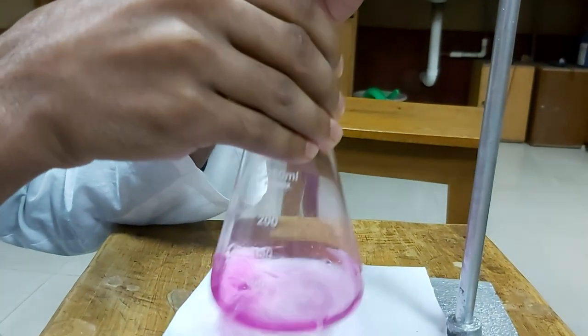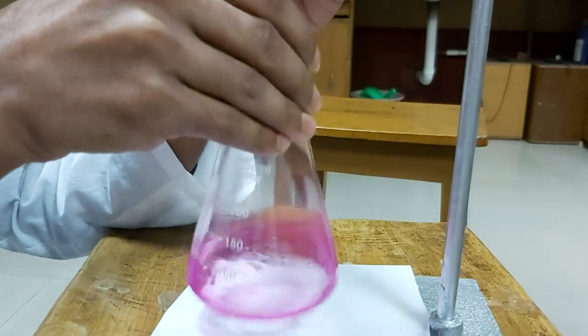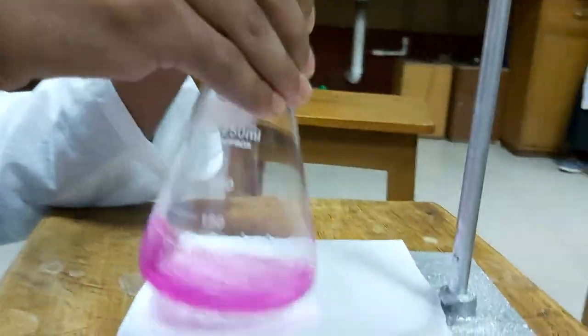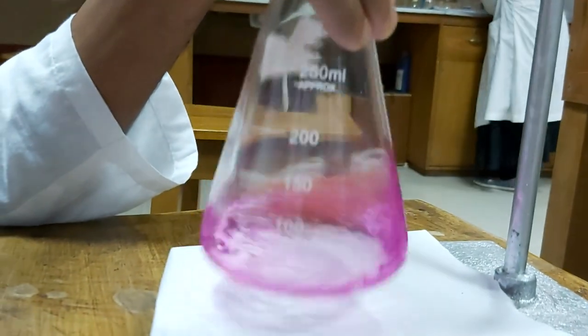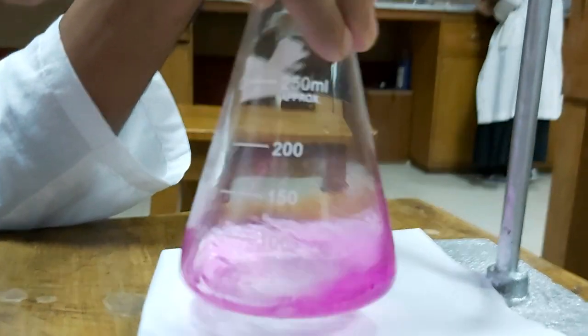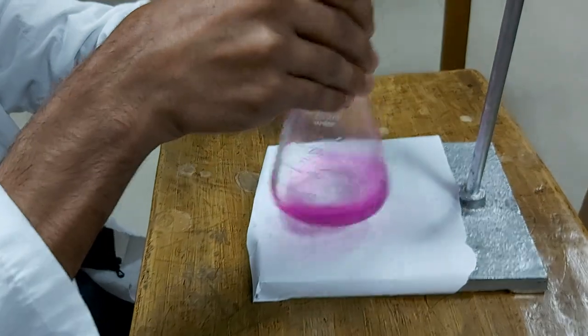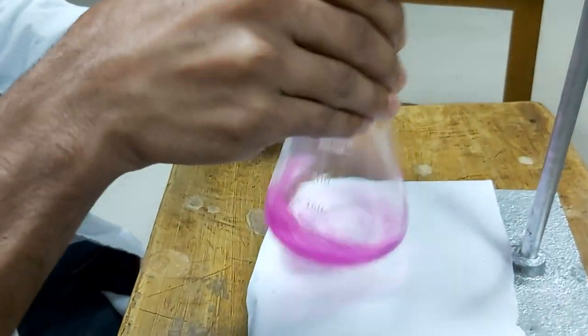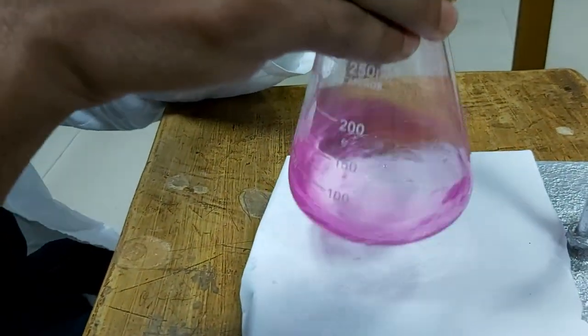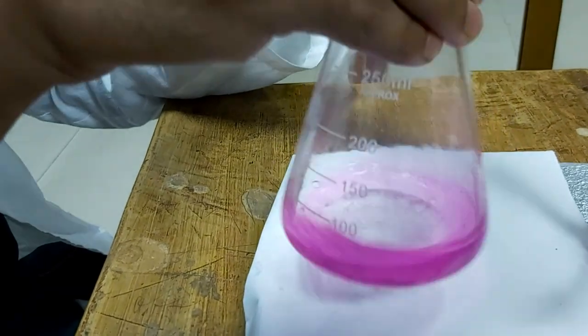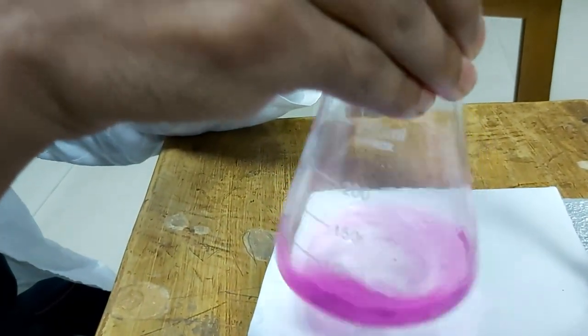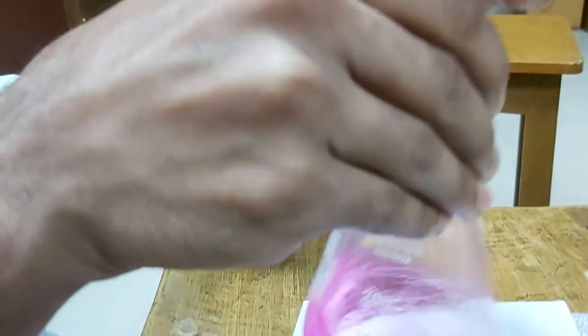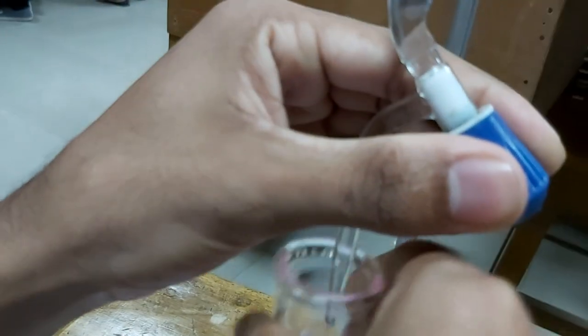The shaking must be done in such a way that there is a whirlpool of the solution, and the shaking must be done at the same time when you are adding the titrant from the burette.